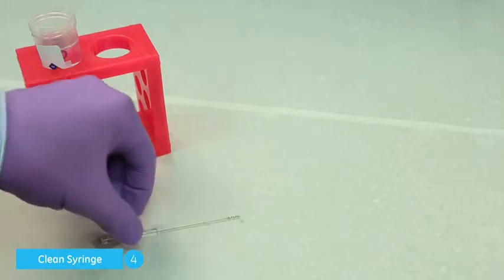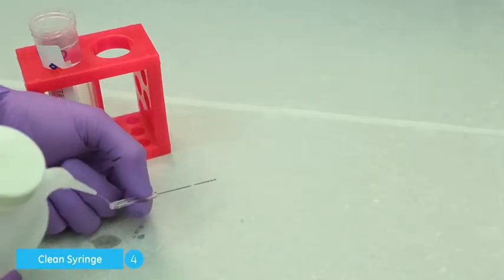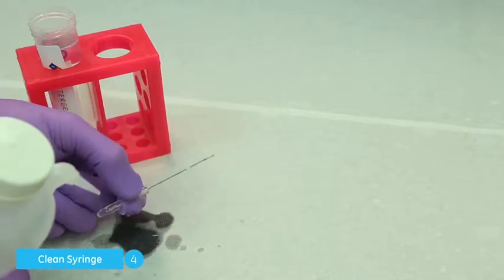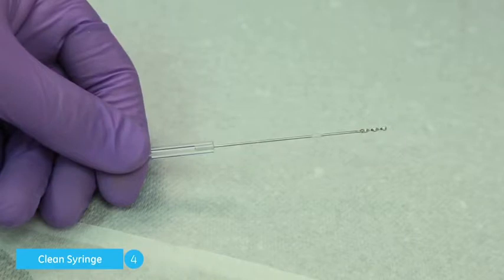Finally, give the glass syringe a thorough rinse with water to remove as much detergent as possible. Drying the syringe prevents sample dilution, and the user may choose to dry it themselves before reinstallation or to perform a cleaning operation using the instrument.